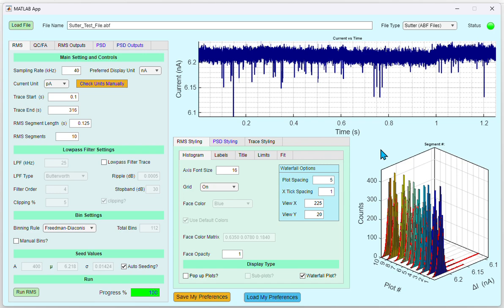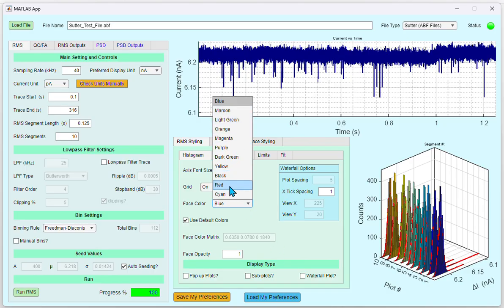If you want to change any of the styling parameters of the RMS plots, click the RMS Styling tab. Under the Histogram tab, you can change the axis font size and the grid. The face color is disabled for the default waterfall plot. If you unclick the Waterfall Plot radio button, the face color and the Use Default Colors options get enabled.